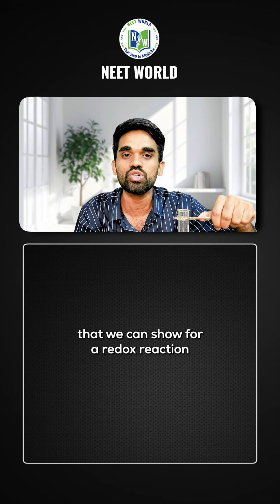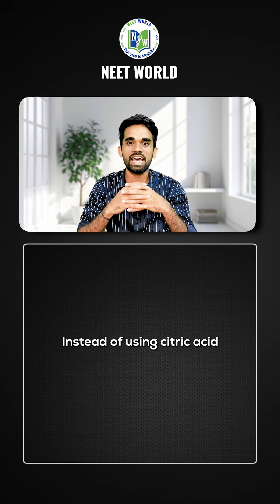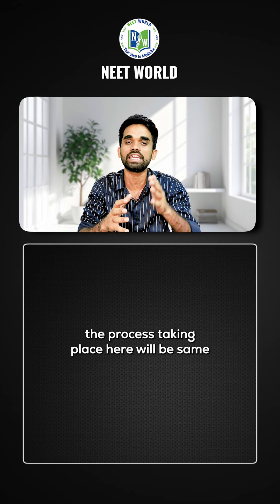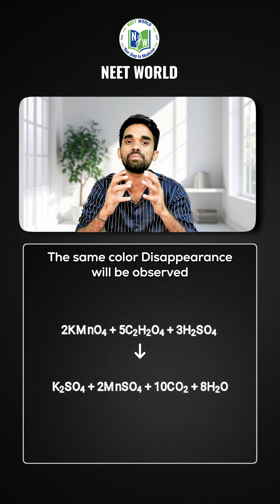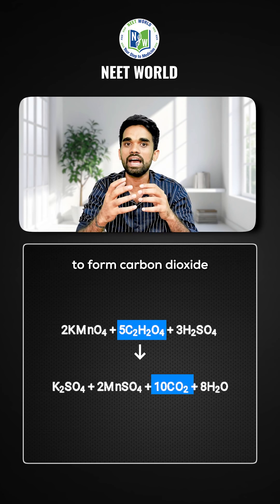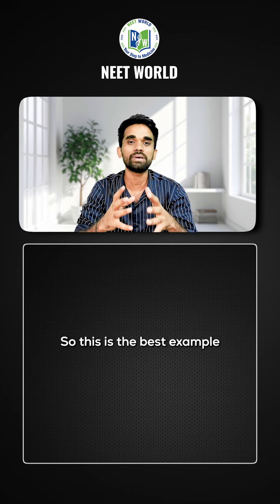This is the best example of a redox reaction using daily life items. Instead of lemon juice, if we use oxalic acid, the process is the same — KMnO₄ converts into Mn²⁺, the same color disappearance is observed, and oxalic acid gets oxidized to form carbon dioxide. So Mn⁷⁺ converts into Mn²⁺.